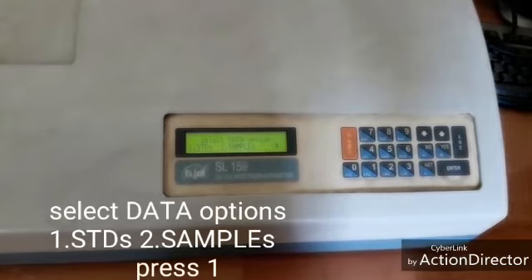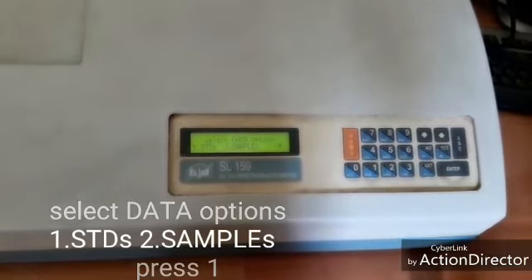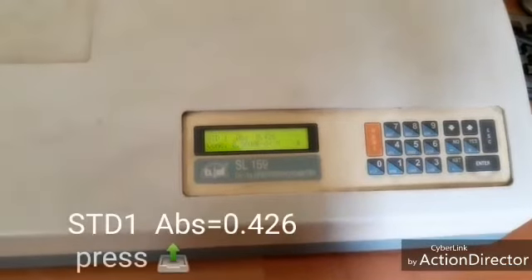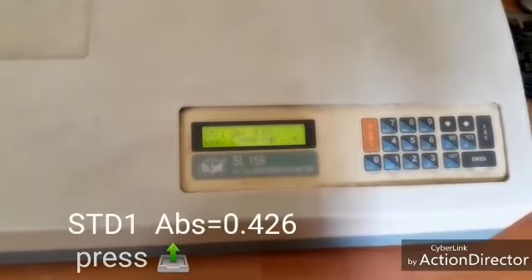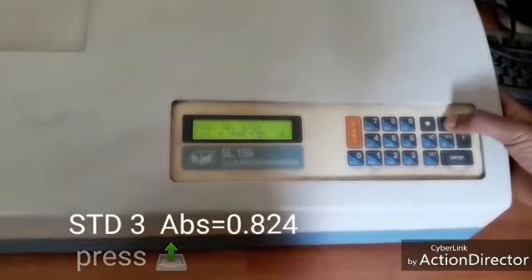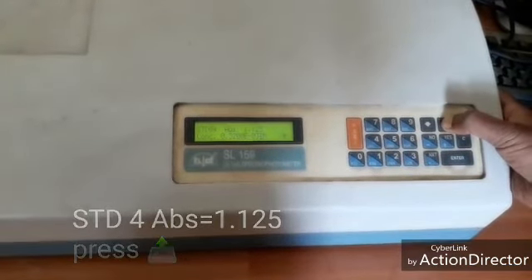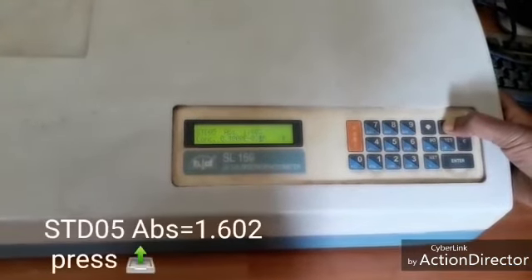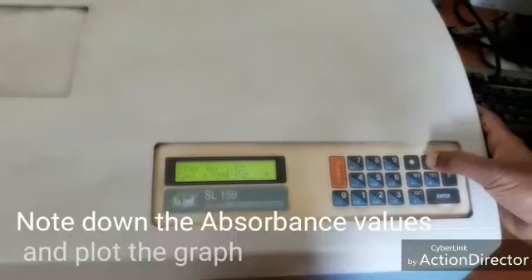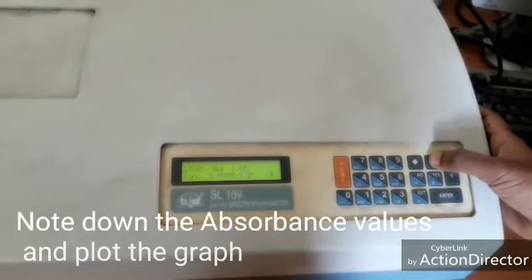Select data option 1. 1 is standards. Note down the values of absorbance and plot the graph.